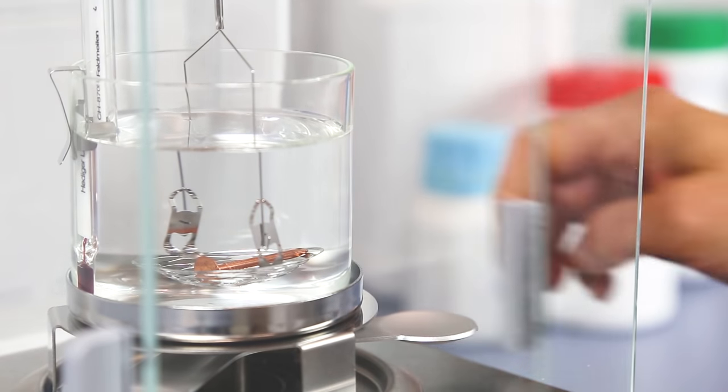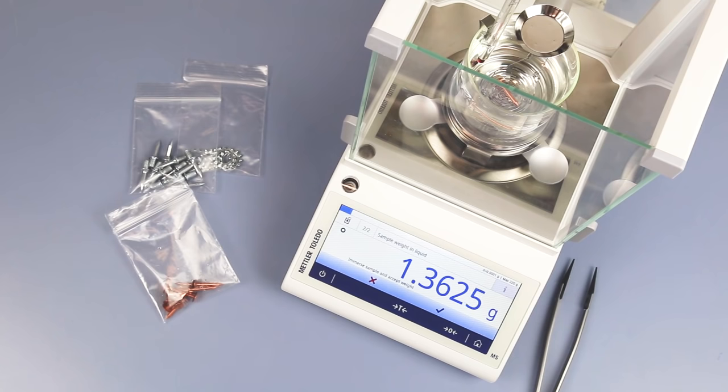All calculations, including temperature adjustment of the reference liquid, are performed automatically.